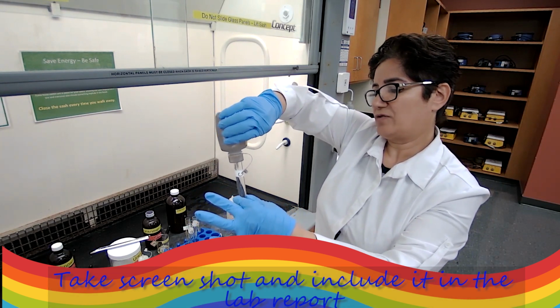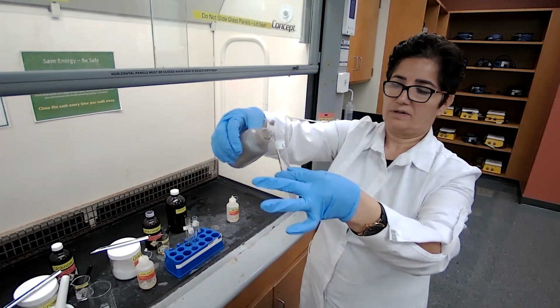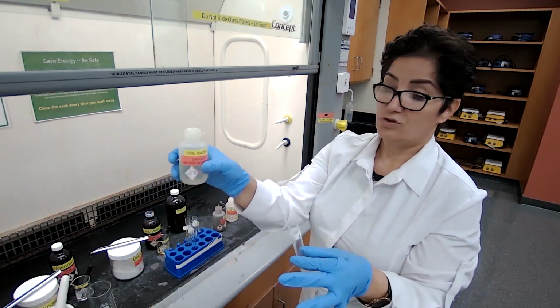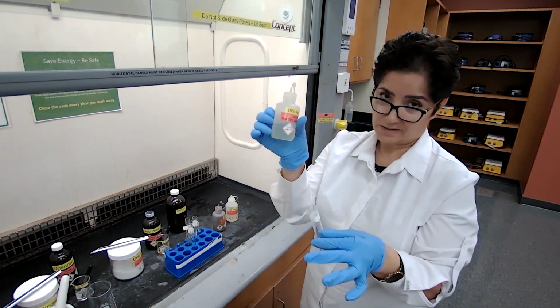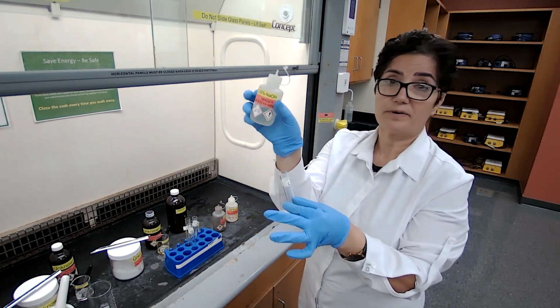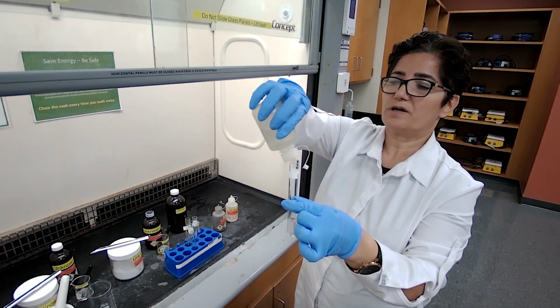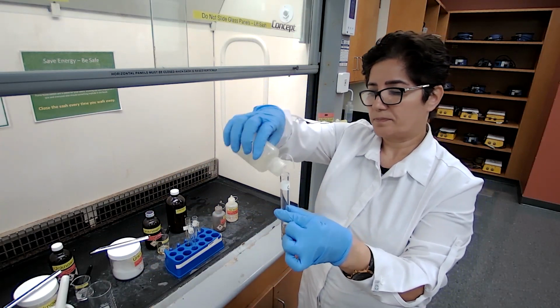So I have about 4 milliliters of silver nitrate. Based on the procedure, you add 1 drop of 10% sodium hydroxide for every 2 milliliters of silver nitrate, so I'm going to add 2 drops of sodium hydroxide here.